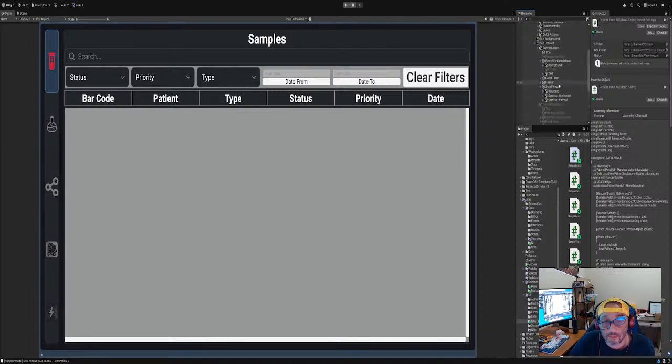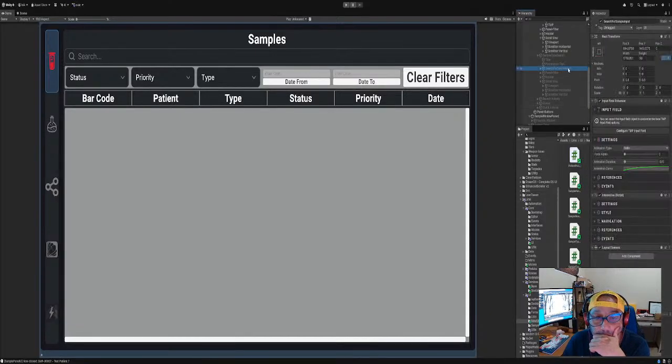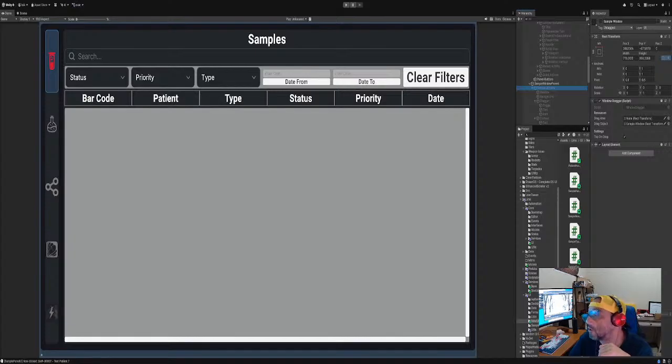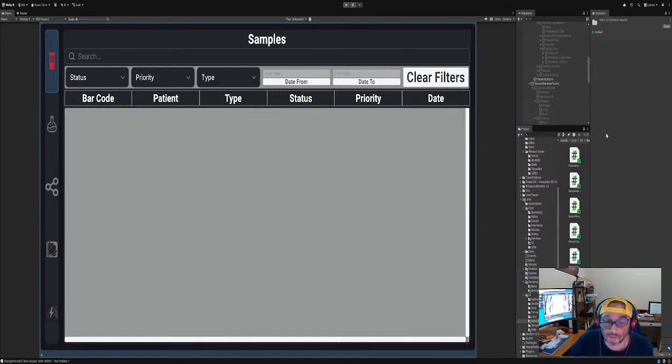Sample. What was it? Sample parent. It was sample parent. There we go, Sample Windows parent. Sample window. I think I'm gonna do sample edit. What should we call the script? Sample edit UI? Yeah. Sample edit UI, right?